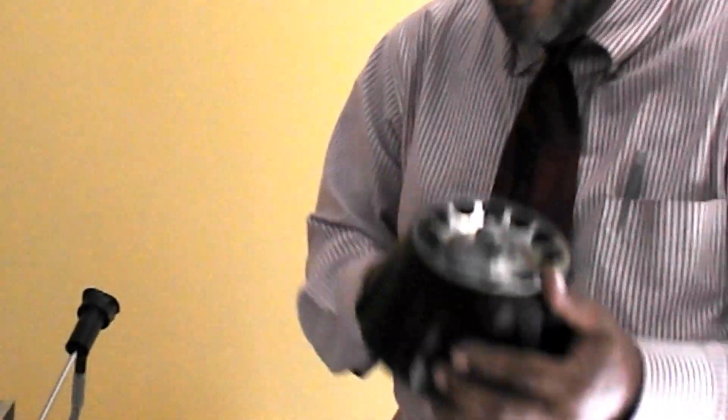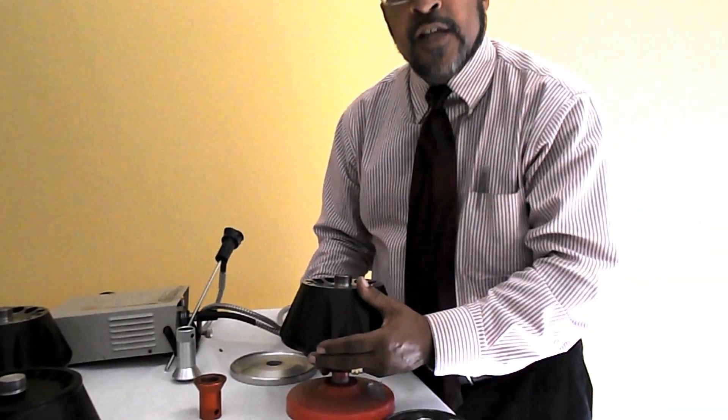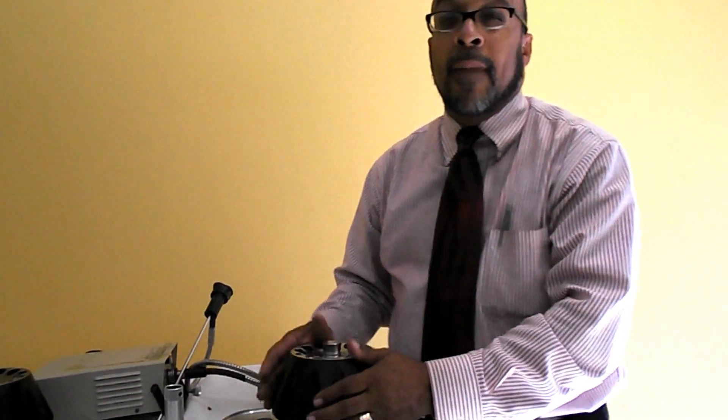When cleaning, this rotor as well as the aluminum rotor, you will use the mild solution. Mild dish detergent and with a tipless brush.